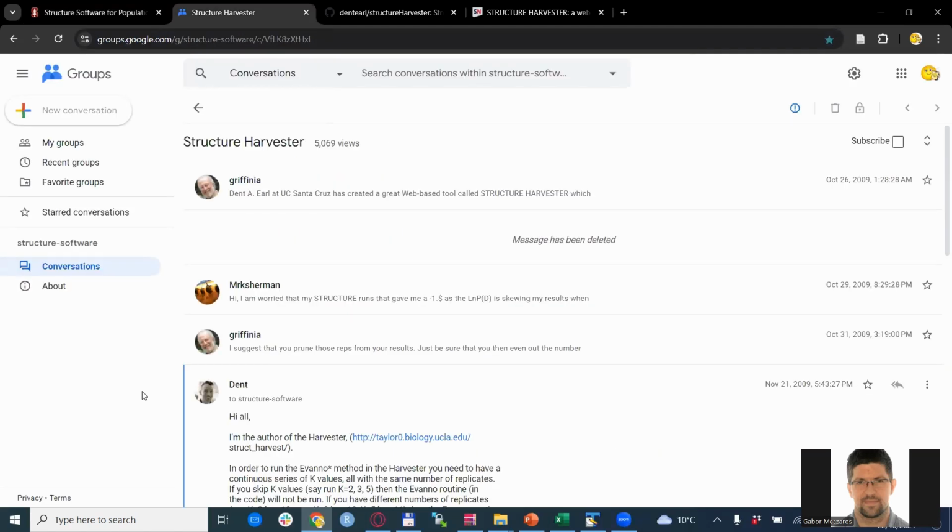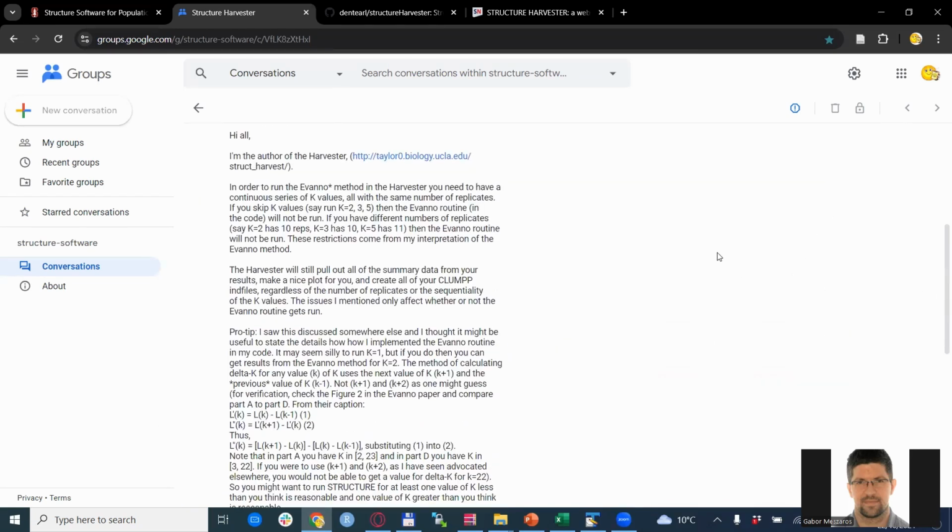When I was researching this topic a little bit, I came across this Google Groups website that actually discusses exactly this topic. And the author of the structure harvester was also chipping in with some very useful information. If we go through his comment, it is quite a long comment, so maybe just the main parts. But most importantly, right at the beginning, it states that in order to run the Evanno method, which is actually the core of the structure harvester, you need to have a continuous series of k-values, all with the same number of replicates.